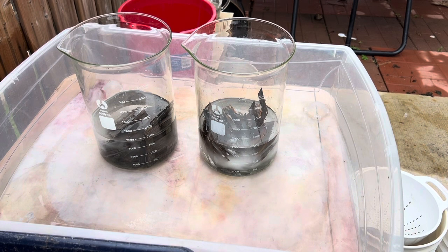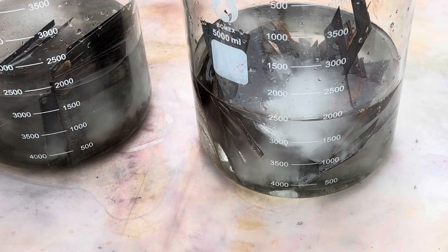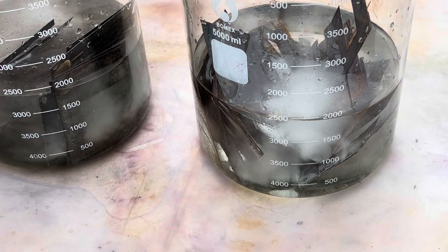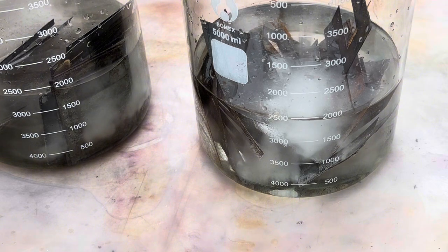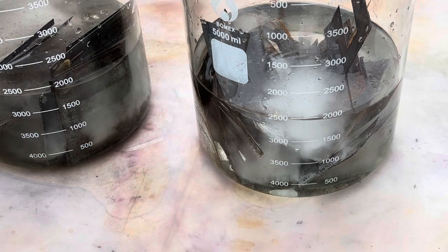I'm using a tall beaker because of the reaction. I'll let it start and once the reaction is done — maybe two or three hours — I'll put it on heat to finish using all the acid. The solution is starting to react, attacking the metals I put in there. Those metals came from transformers I broke apart to get the copper, and I set aside the iron pieces. This metal is iron and should not have any plating — it should be just plain iron.